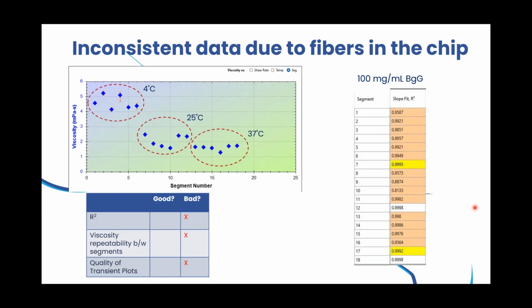So what happens when you have fibers in your channel? This is the data we took from a chip that we confirmed had fibers in it. The data we took was not good. We can see here in the table the R-squared values are low, and the repeatability between viscosity measurements is low. You can see how the viscosity repeats for each temperature are not consistent, and the quality of the viscosity versus time plots was affected as well. This is the viscosity versus time plot you see in the software for these instruments. These are signs you can use to determine if your chip has any fibers in the channel.